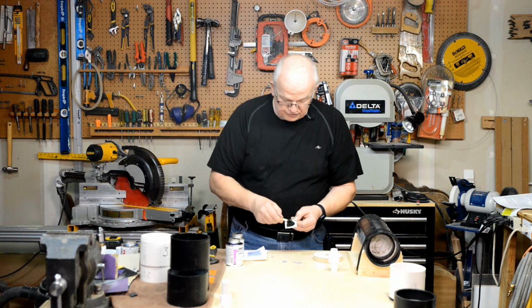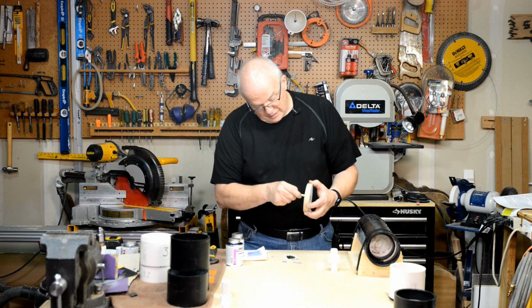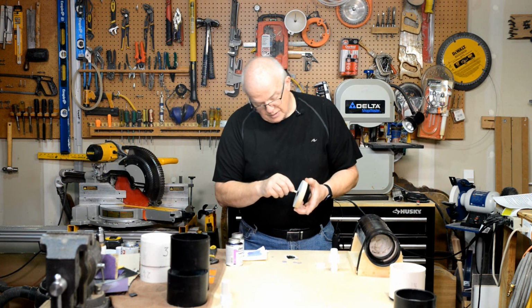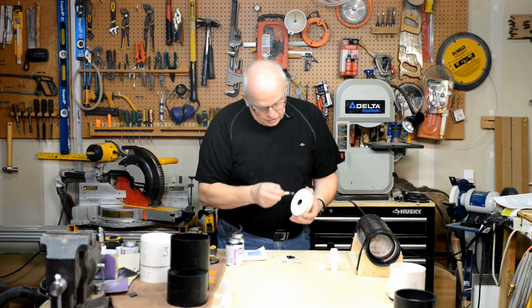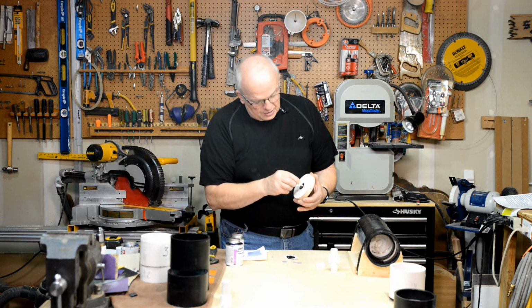And what I'm going to do first is take some of this on the end of this stick and apply it to the inside of this. It doesn't have to be a lot, but you do need to apply it to the inside of this. Okay? And then you're going to want to take some and put it right around that outside edge so that that PVC will seal onto it. Doesn't have to be pretty, and I think you kind of get the idea of what I mean here.